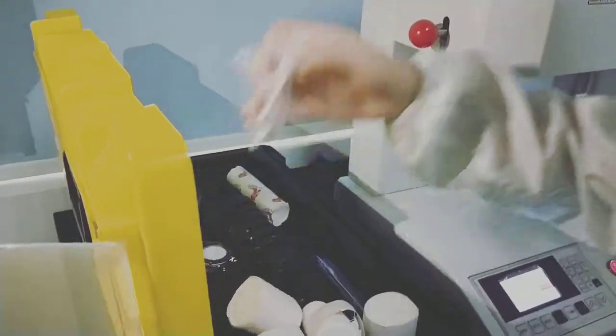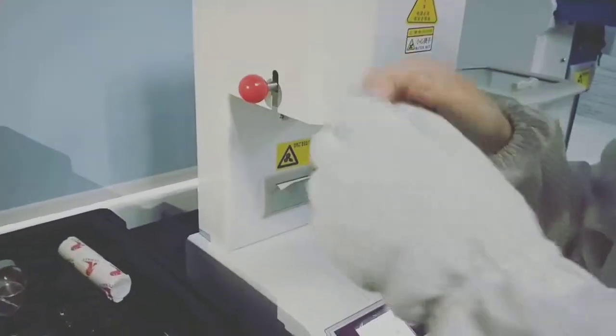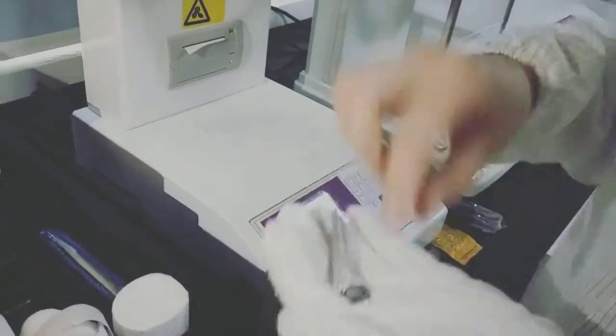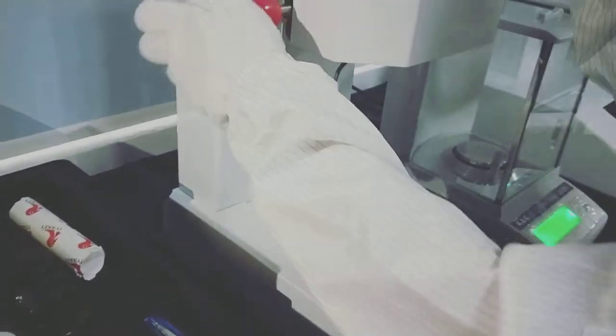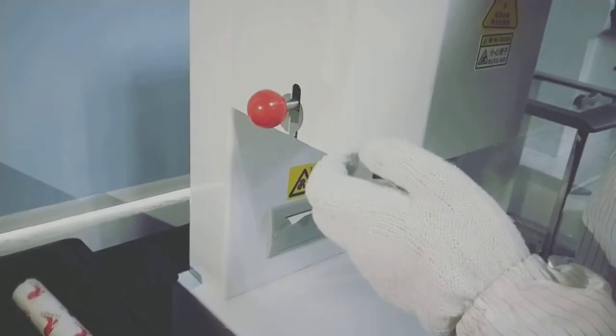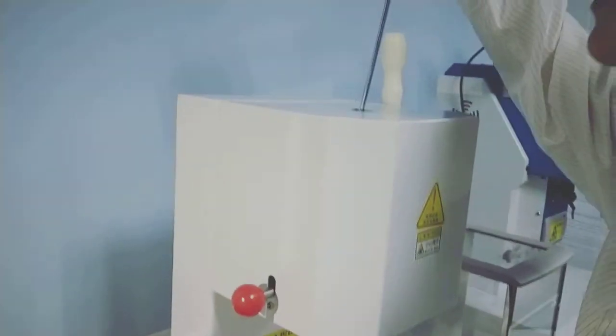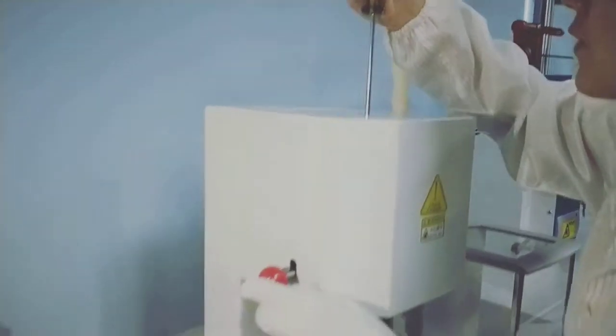And here is the die and the die cleaning rod. Now we add the die into the sample. Press this button and put the die from this hole.